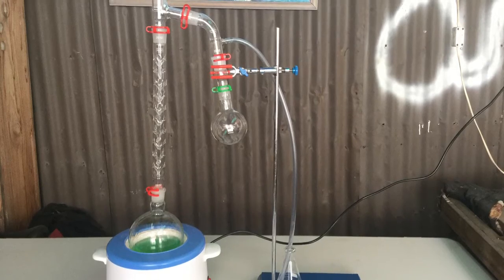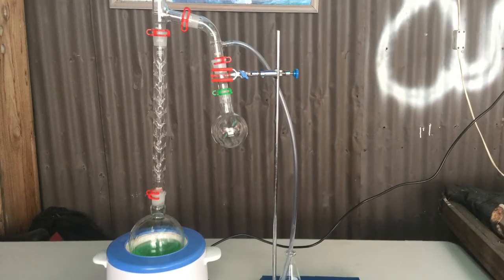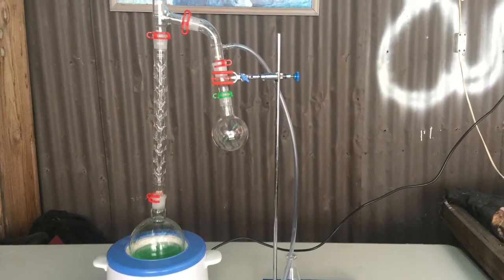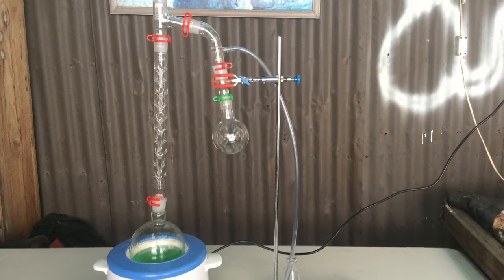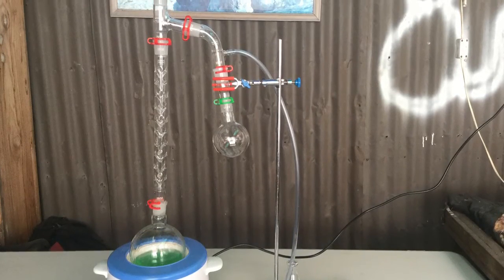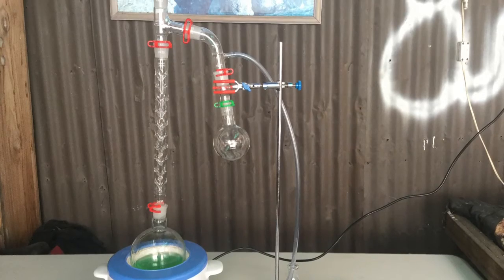As you can see I have a tube connected to the vacuum takeoff and this is because it was thought that hopefully the gaseous DCM fumes that escaped would be somewhat controlled and possibly condensed into the flask.